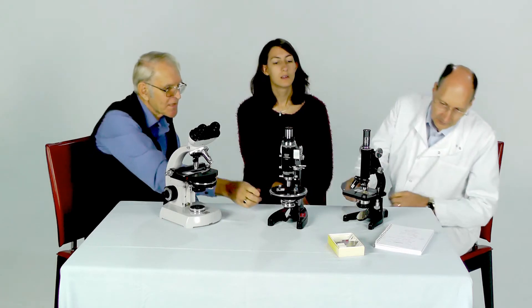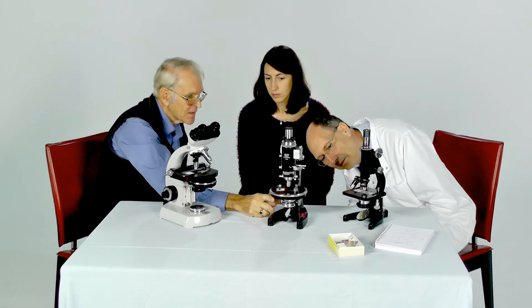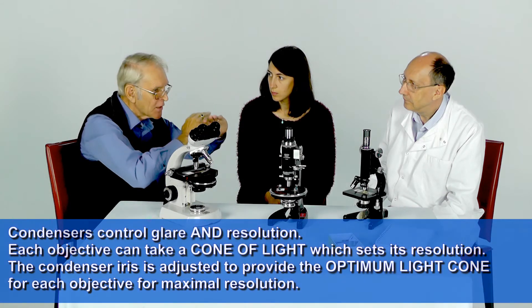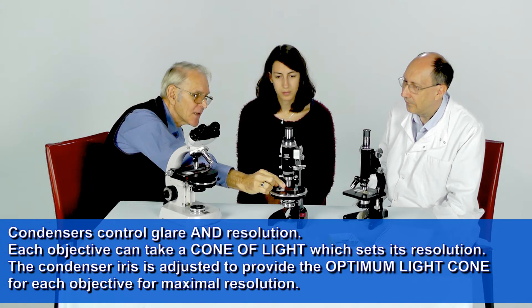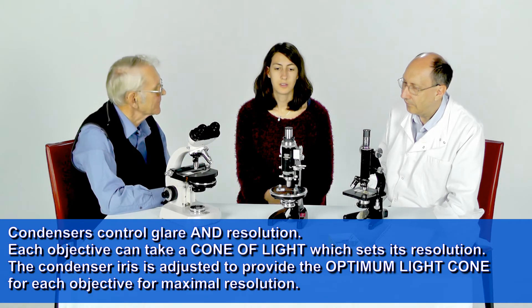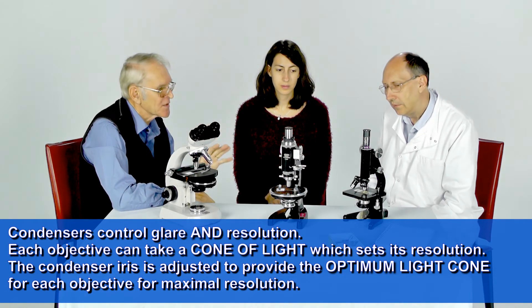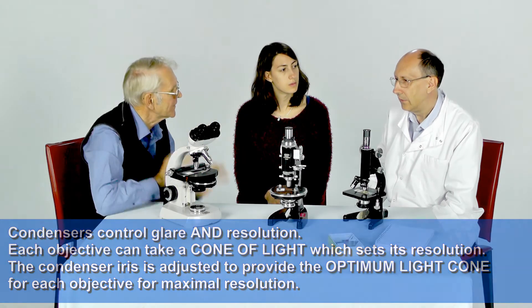The size of the gap in the middle of the iris diaphragm controls the size of the cone of light that's coming up from the object into the front of the objective lens. So it doesn't glare it out if you've got the right amount. And if you can get it just right, then you get a good balance between lack of glare and plenty of contrast.